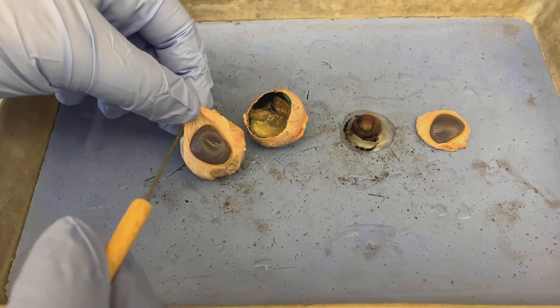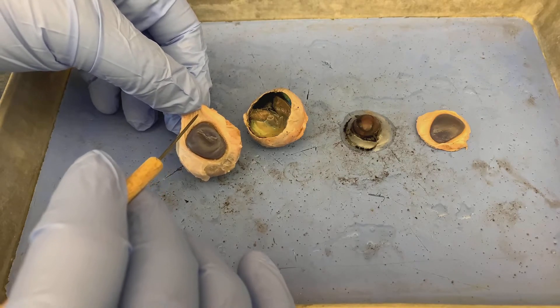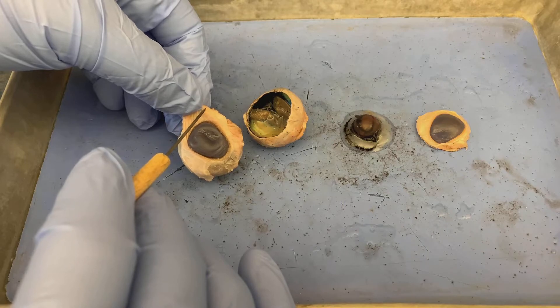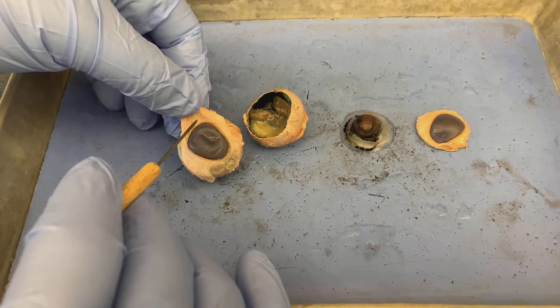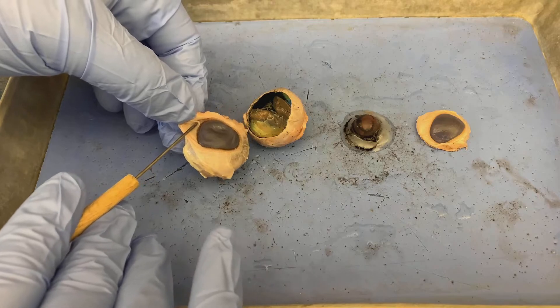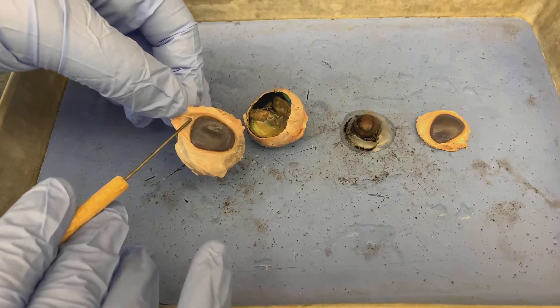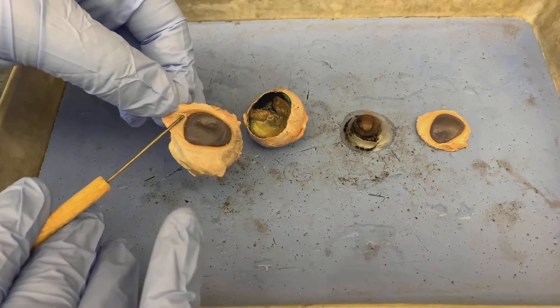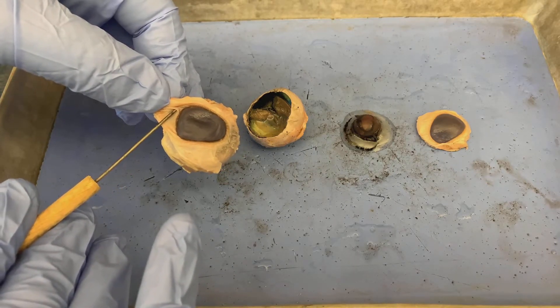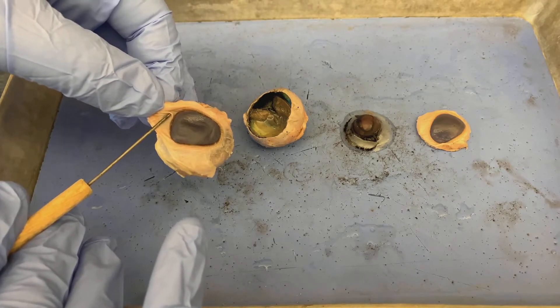This tissue here, which I have not cut away on this view, would line the undersides of the actual eyelids as well as the very front part of the eye. This is called the conjunctiva, this thin tissue here. Some of you have had pink eye in the past — pink eye is otherwise known as conjunctivitis, so this is the layer of tissue that gets inflamed and infected during conjunctivitis.